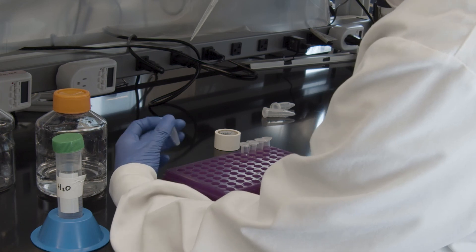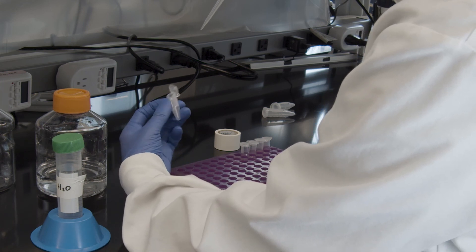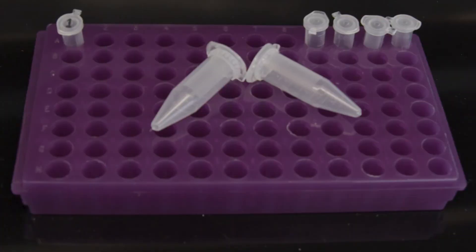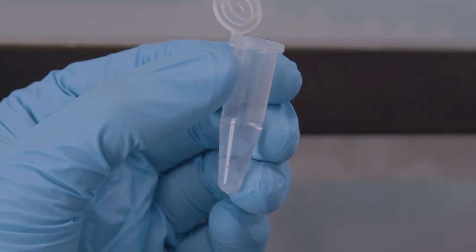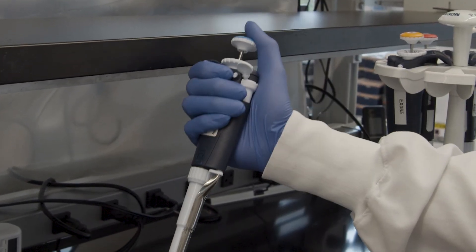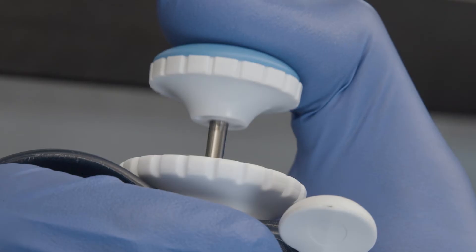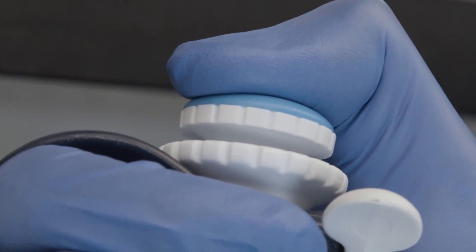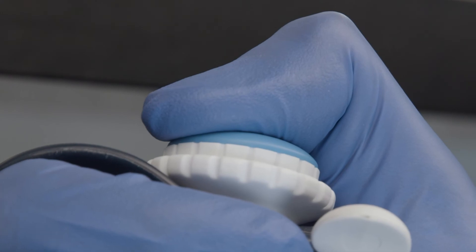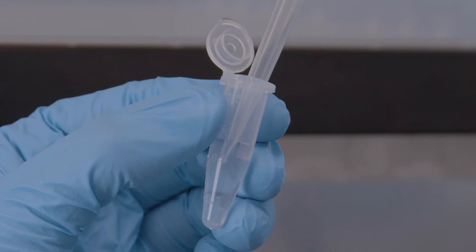Now, place the pipette tip into the container you're using to hold the measured liquid. This is your microcentrifuge tube, conical tube, or plate. If the tube already has liquid, insert the tip into the liquid. Now, slowly press down the plunger to the first stop. Wait, then press down all the way to the second stop. This ensures that you'll expel any excess liquid from the tip.